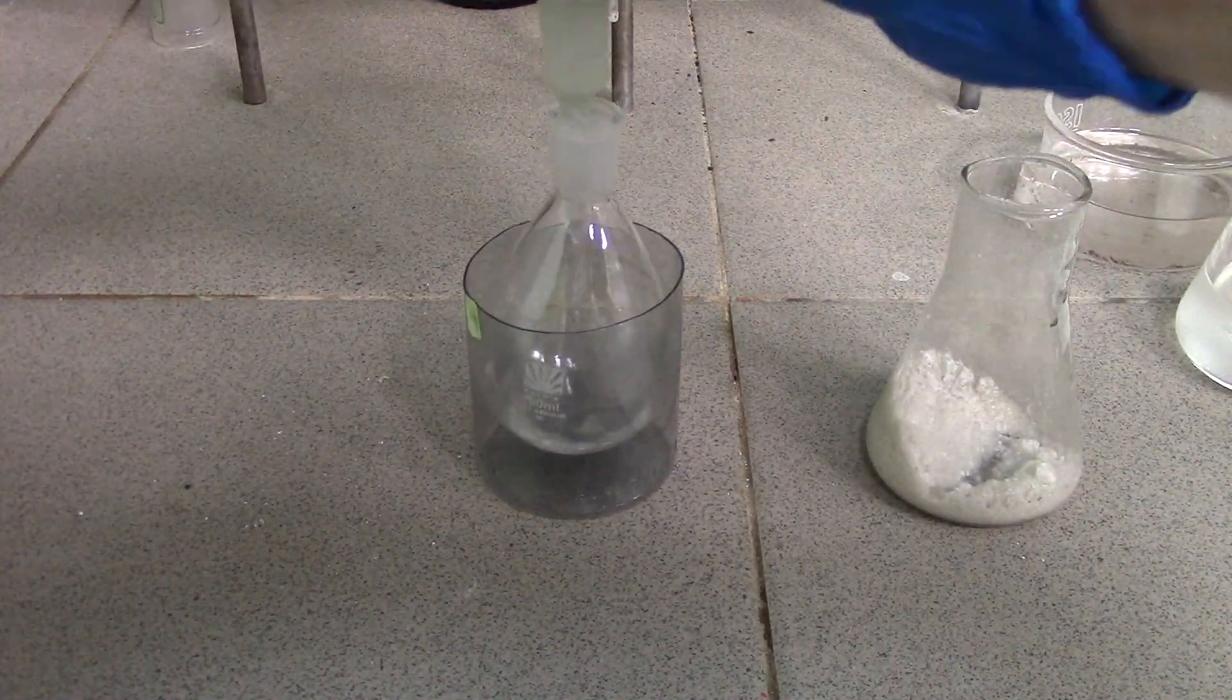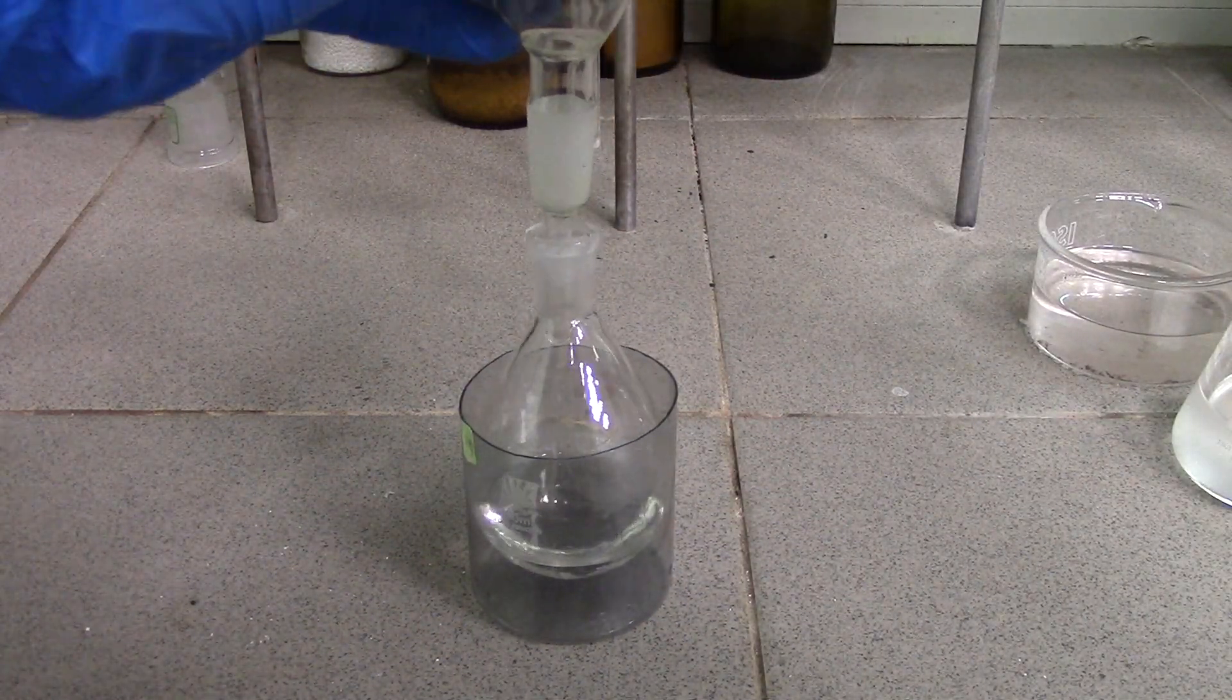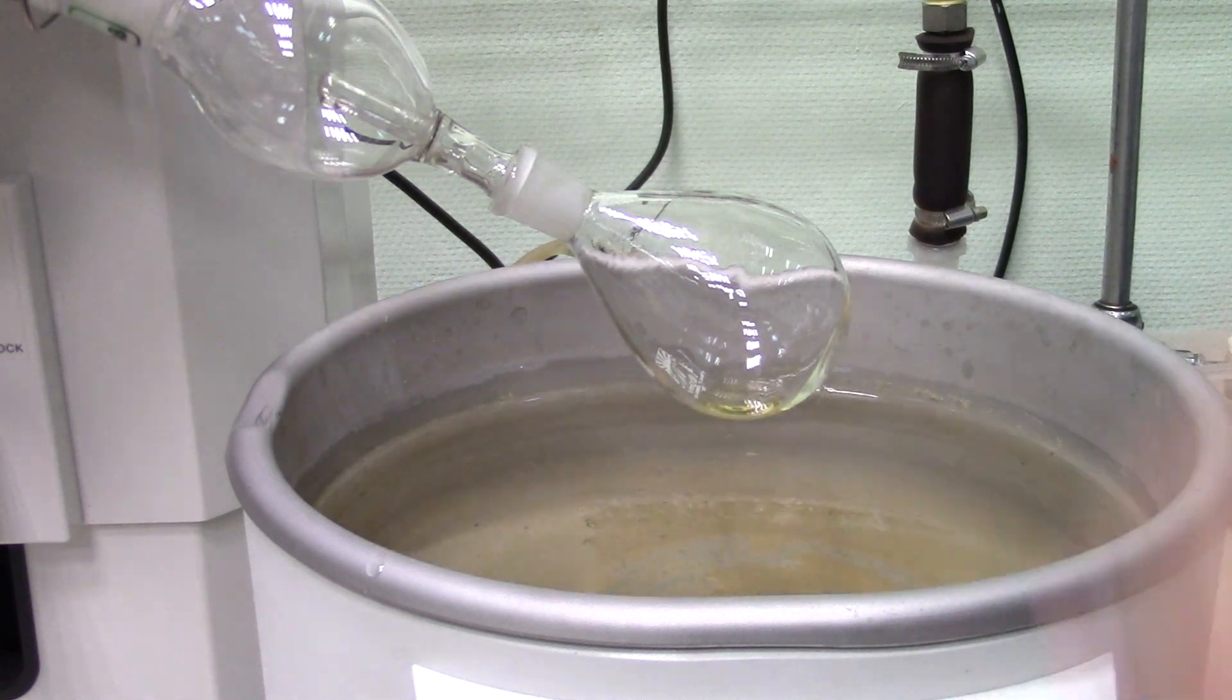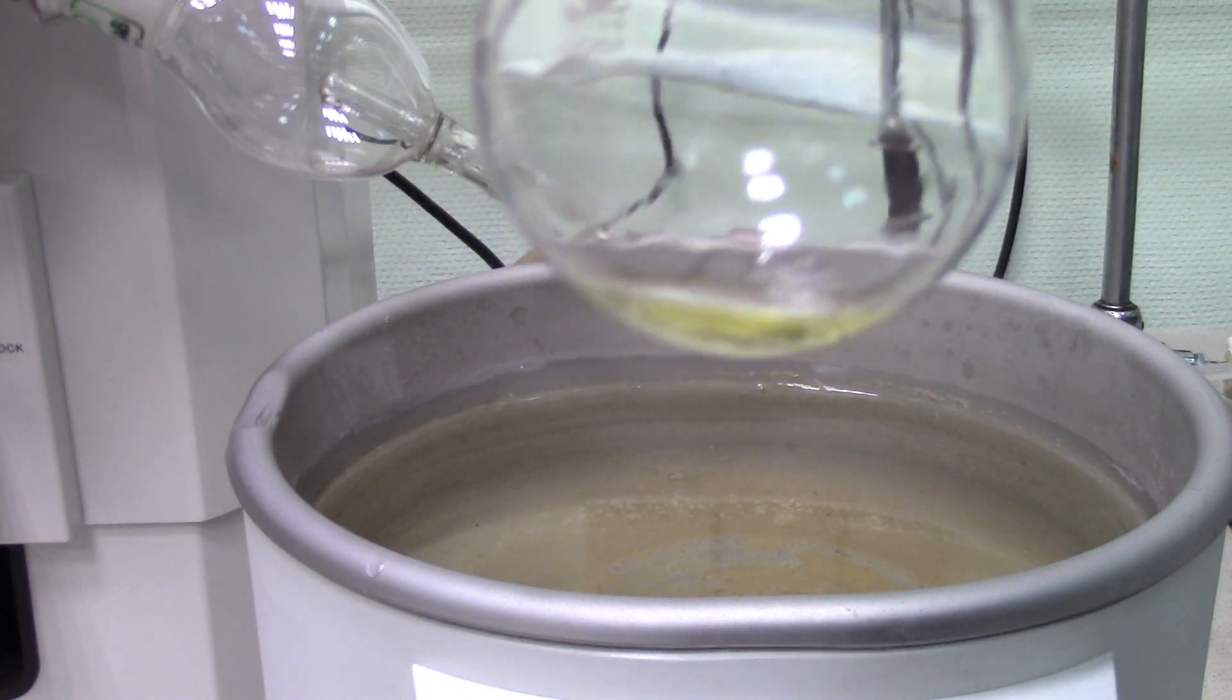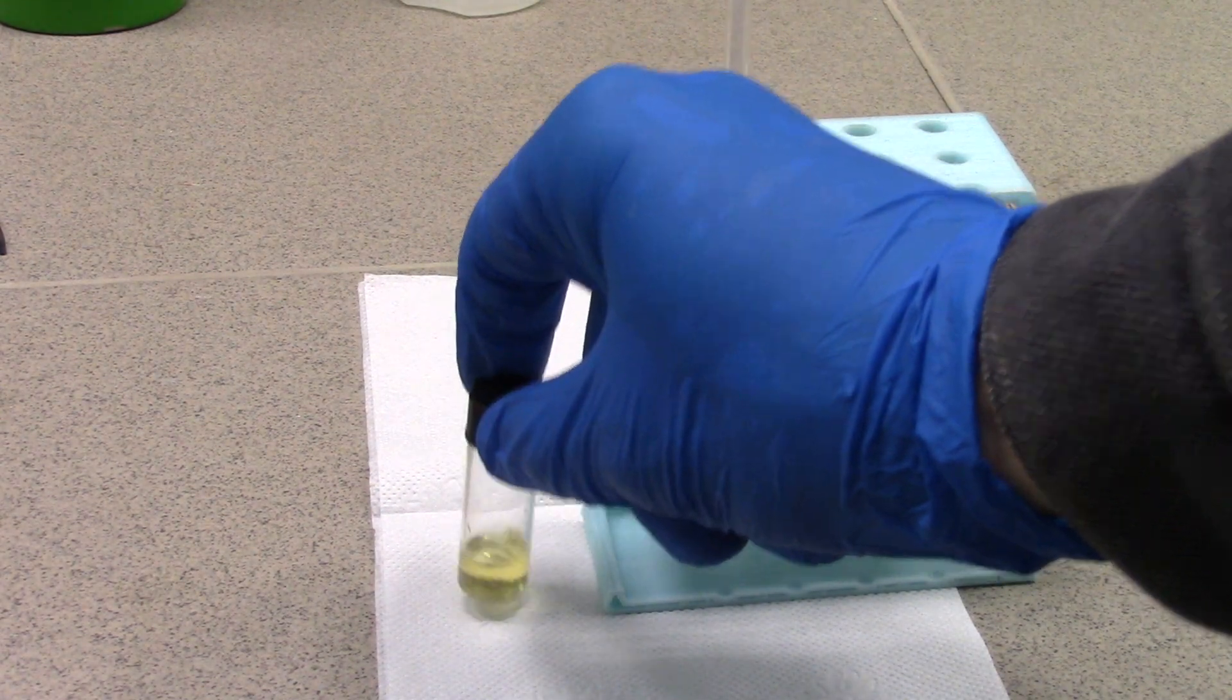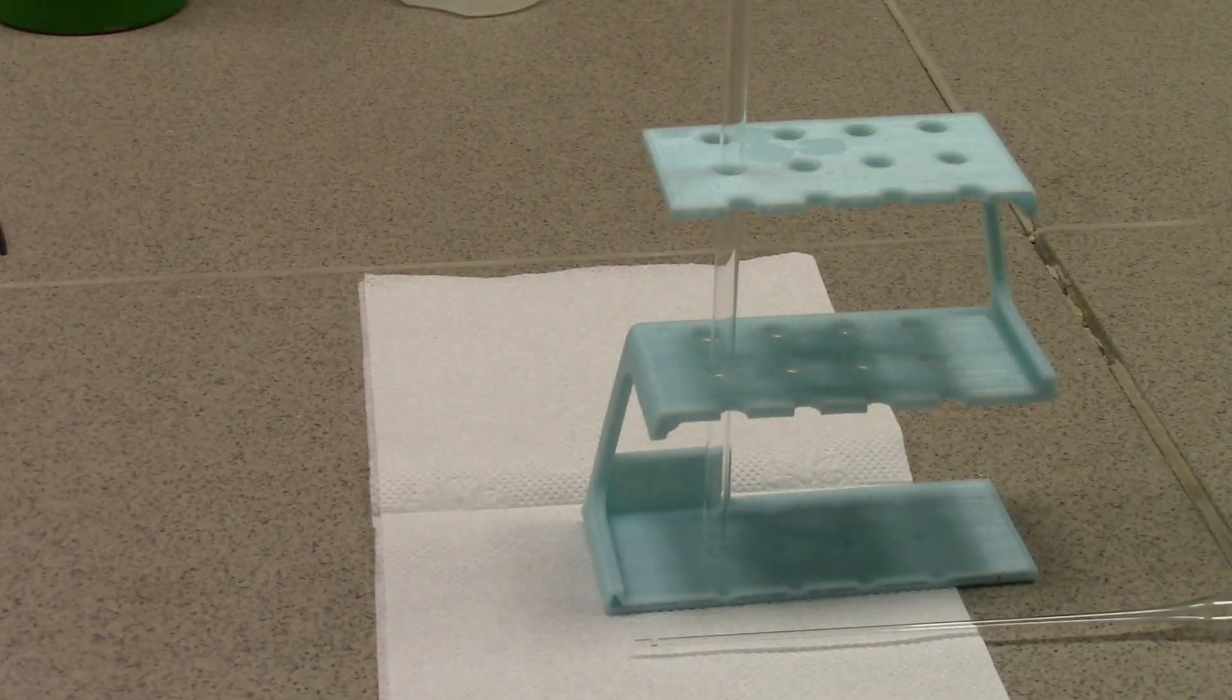Finally, I have filtered the dryer off through a 100 porous glass filter by hand and spun the liquid on a rotary evaporator. Hmm, smells like celery. Great, we successfully made pretty pure dibutyl diglyme, and it was proved by NMR spectroscopy in deuterated acetone.